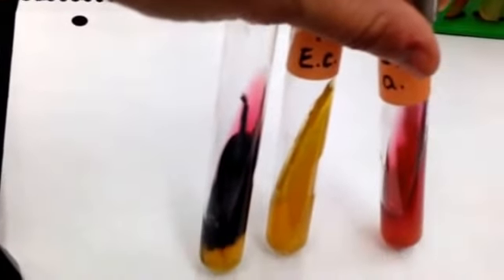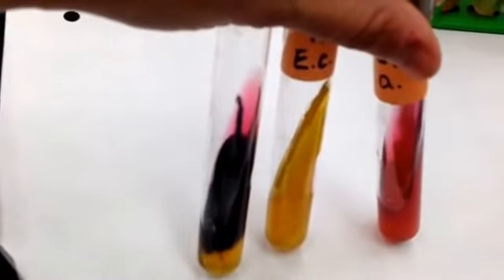The pH indicator phenol red indicates the presence of acid. It's yellow at 6.8, or ammonia. It is fuchsia pink at 7.4. Acid results due to the fermentation of the sugar. Ammonia results if the proteins are metabolized instead. Facultative anaerobes ferment sugars first before metabolizing peptones. And this is, once again, the triple sugar iron agar.